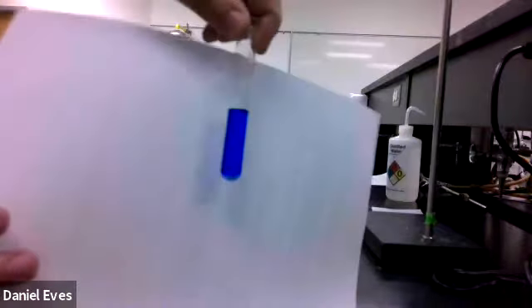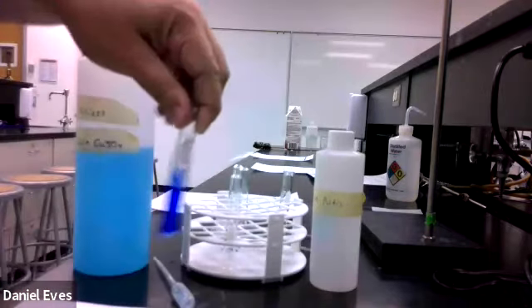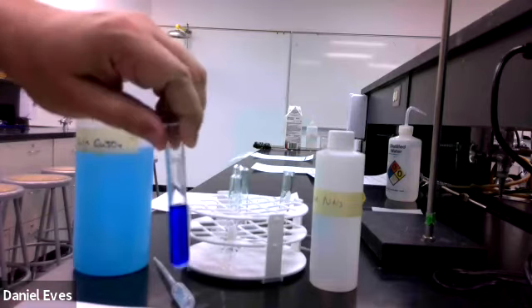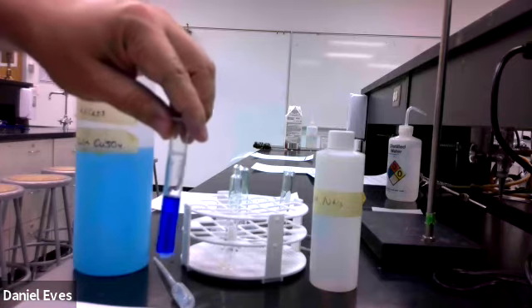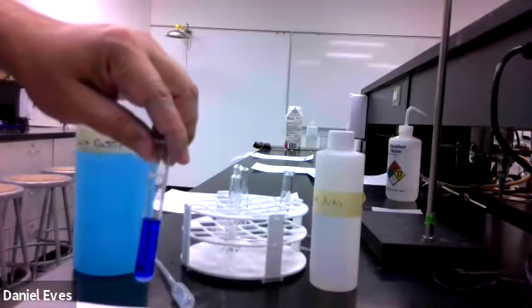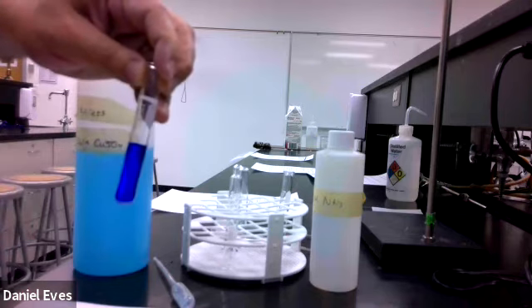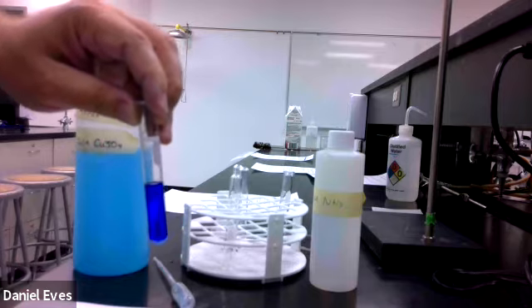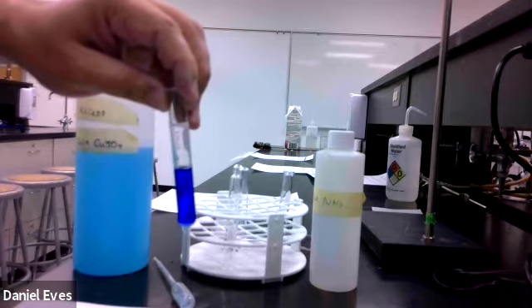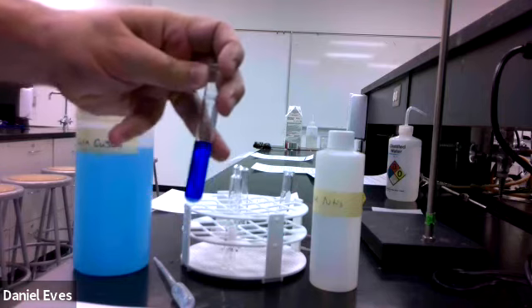Okay, let's see if we can do it that way. There should be just a little bit of solid there at the bottom. We can see that's the whiter part, and then above that we have the dark blue. So based on what we know from the equations that are in our lab, which should be the dark blue part? Is it the thing that's the solid, or is it the thing that is still aqueous? Right, and then, so on the bottom we have the solid, and in this we have the aqueous part, and they both are products of the addition of the ammonia. And the ammonia is going to make it basic, so it's going to make hydroxides, and the individual ammonias are going to interact with the copper to give us that nice dark blue color here.